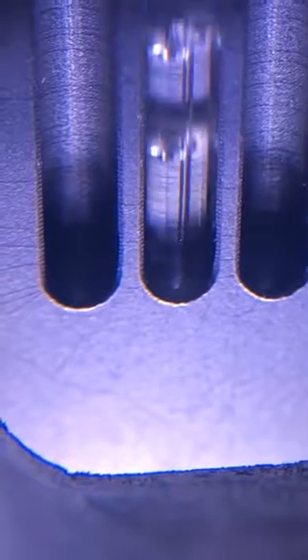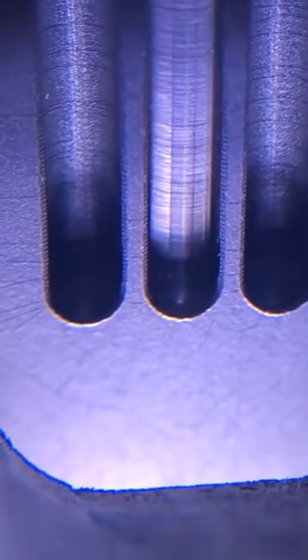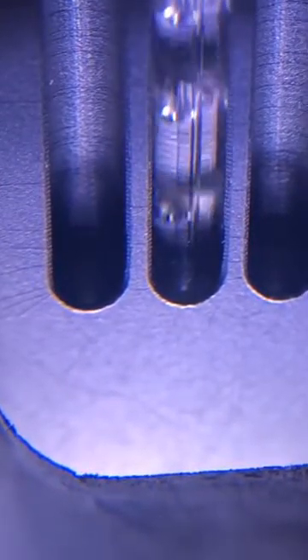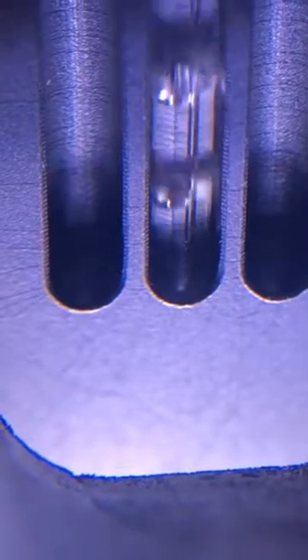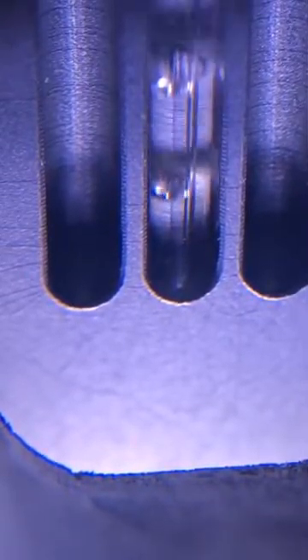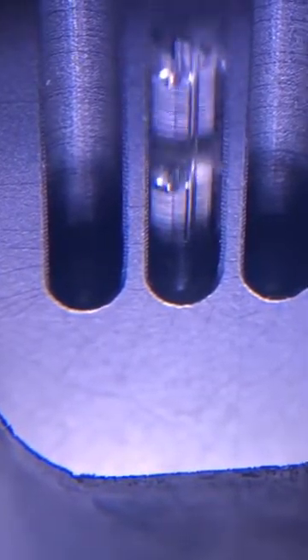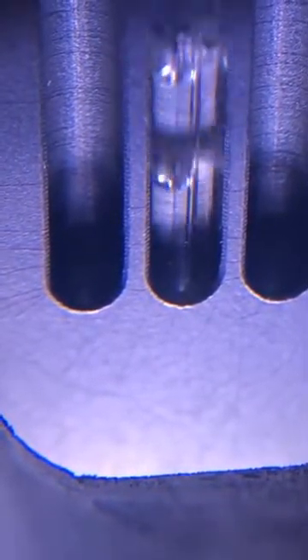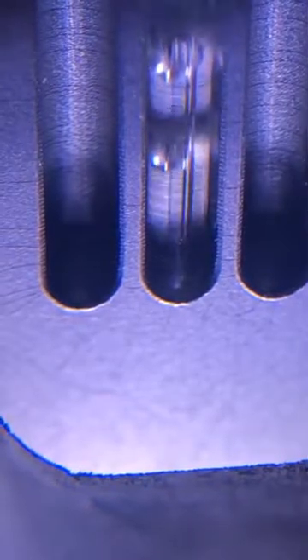Going up. Over 109.2. I think it's fluctuations in heating. Over 109.5. When you get to the boiling point, you'll see it looks different. We're not even at the boiling point yet.